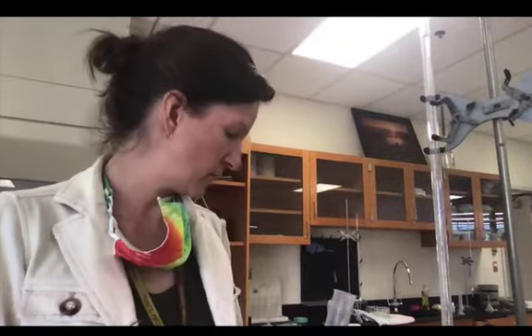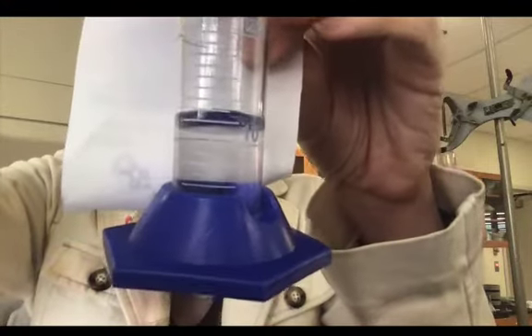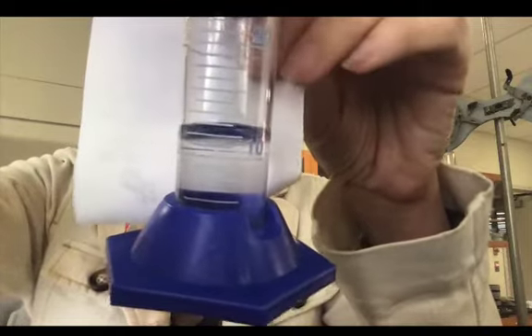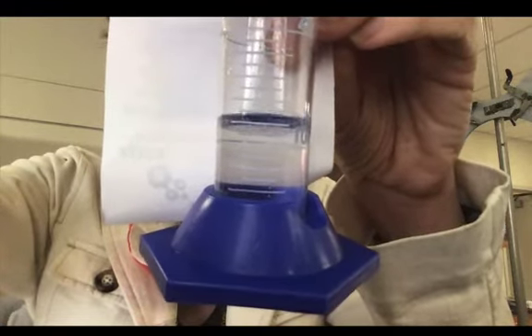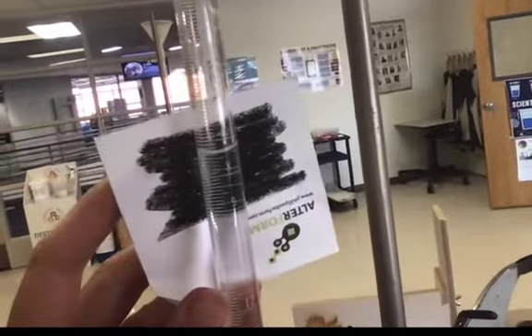This will serve as your data for your titrations assessment. There's your volume of the initial trial for the acid reading to the bottom of the meniscus — that's your initial burette reading.